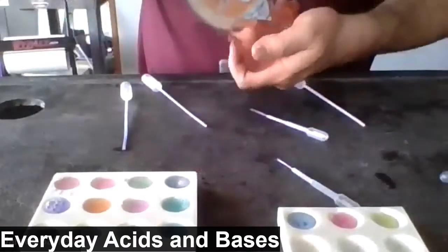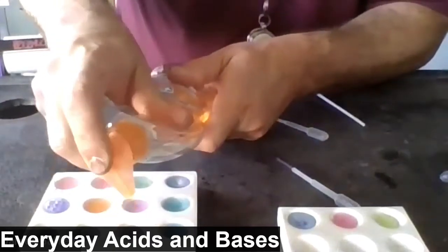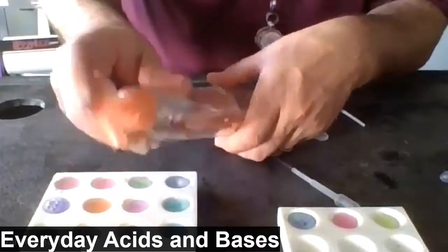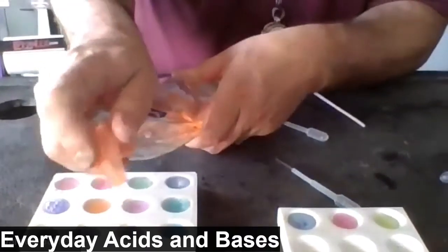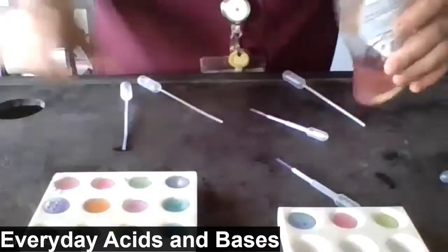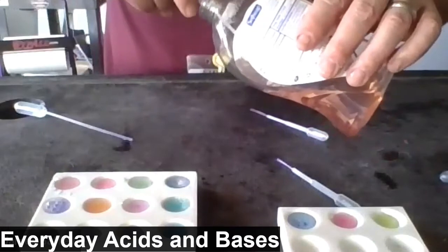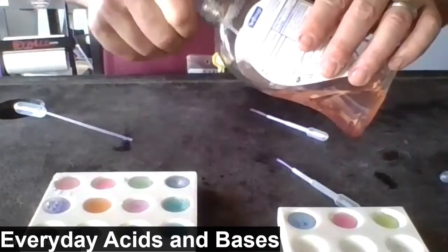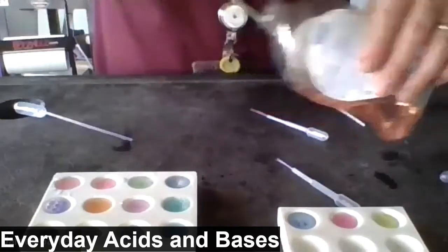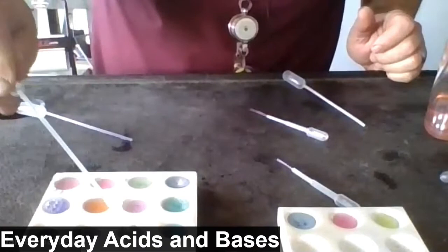Hand soap. Having a hard time getting this out here. I'll pour. Maybe I'll use a squirter. We add the hand soap to this well.